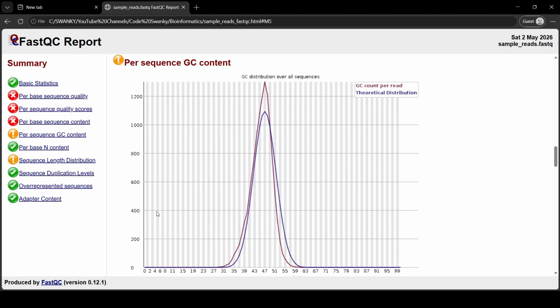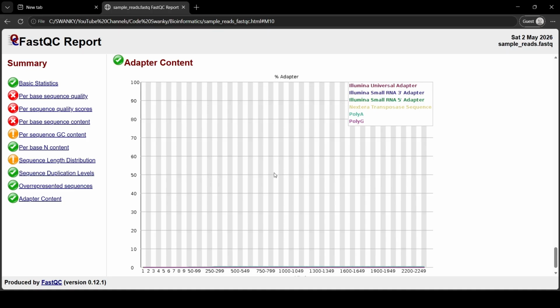Okay, second, let's check the adapter content at the very bottom. Adapters are artificial pieces of DNA glued to your sequences so the machine can read them. If they accidentally got sequenced along with your actual biological DNA, this graph will shoot up. And if it does, you absolutely must trim them off before aligning your data. Okay, and this is FastQC basically. You can check out the other tabs also after you run your own tests.